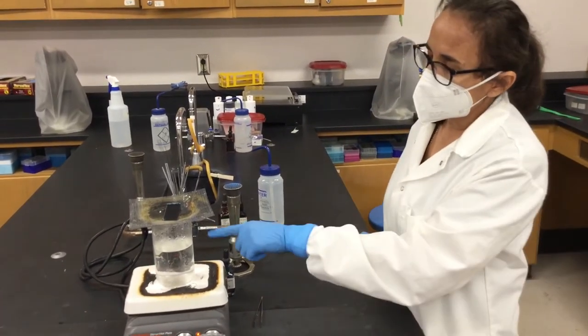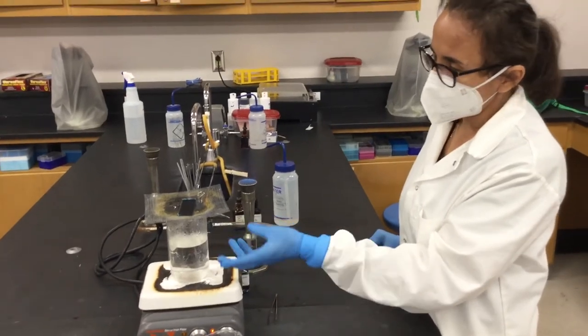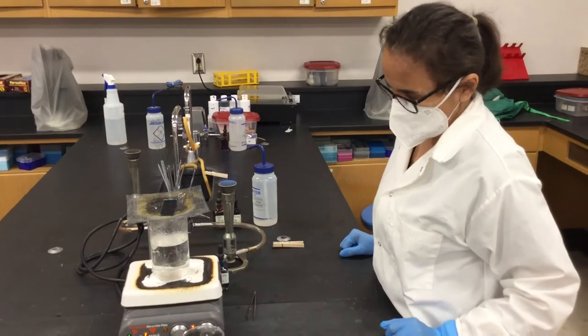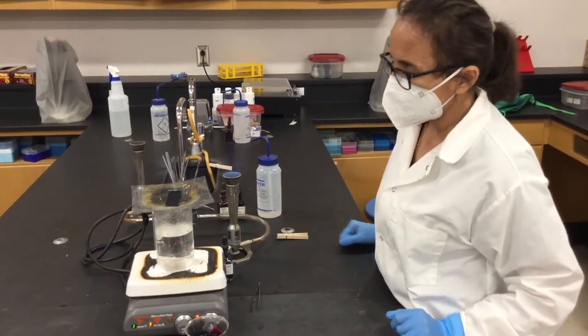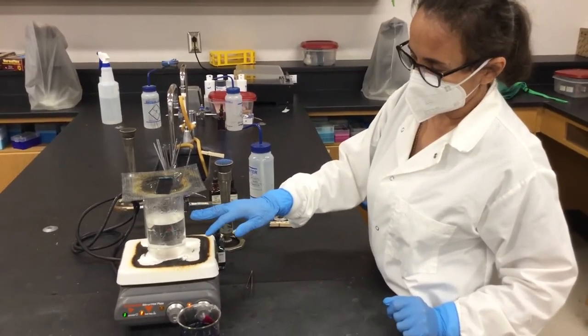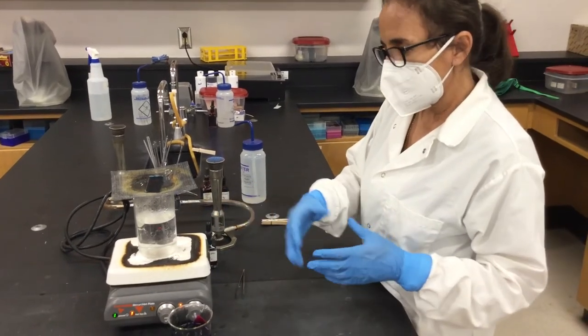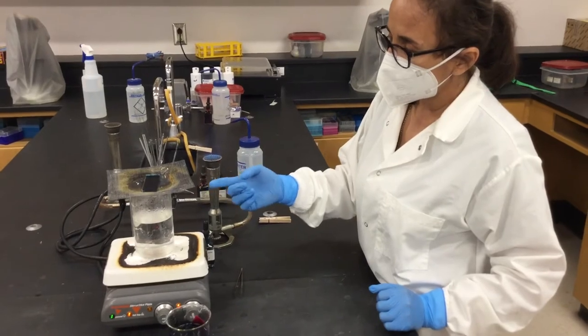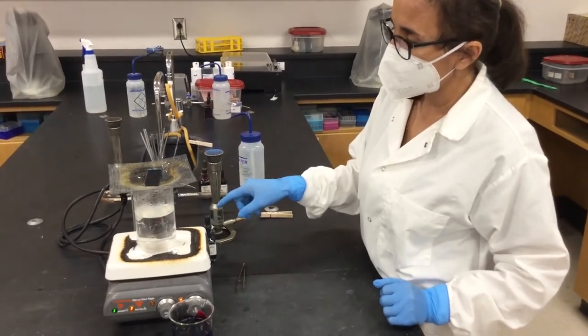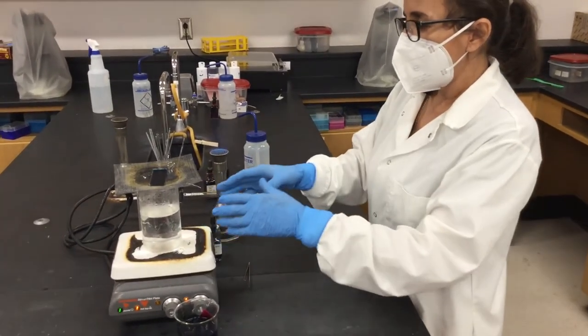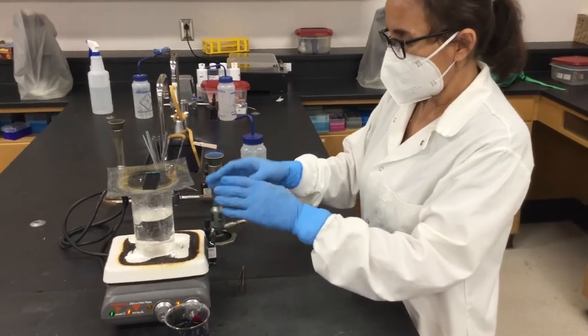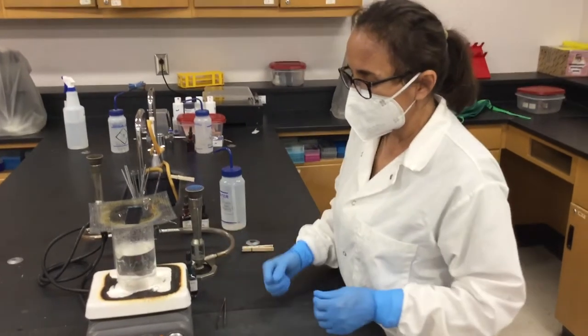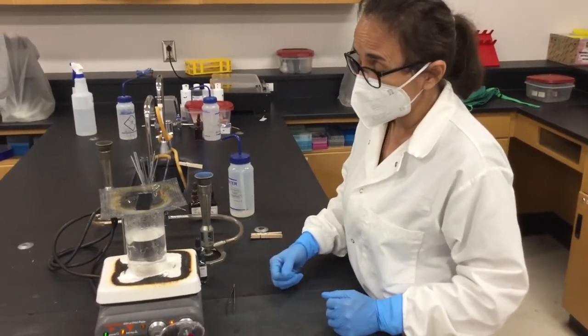Now the water in here doesn't have to be boiling. It just will be releasing the vapor little by little. So that's another thing. Sometimes you see in some labs where they keep the water boiling but that's too much heat. And as well, when you're adding this dye, you have to be careful to not put it into the beaker or your hot plate because it's going to stain everything. And this is one of the stains that is hard to get rid of.